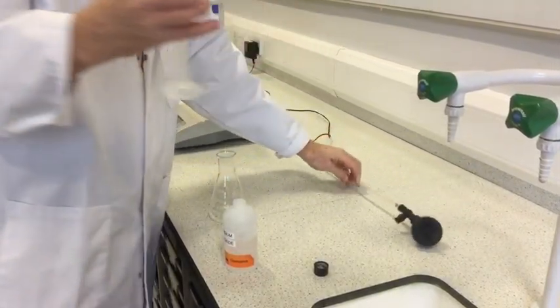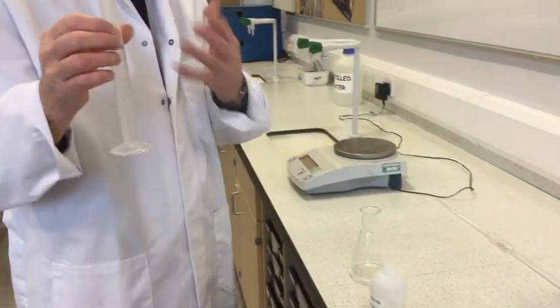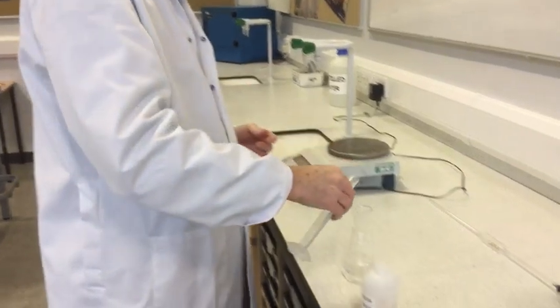Followed by 25 cubic centimeters, approximately, of deionized water.